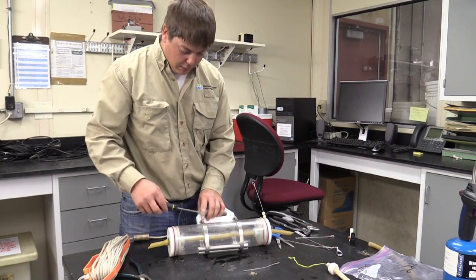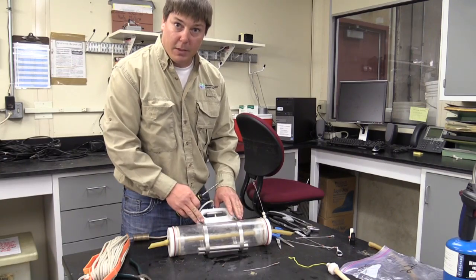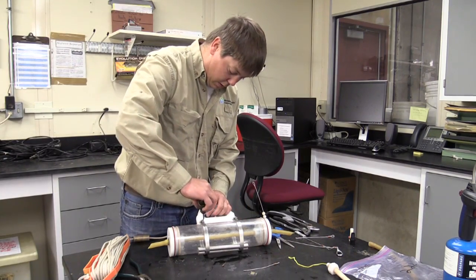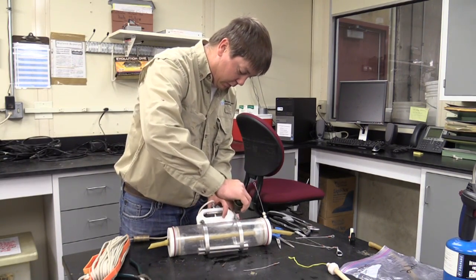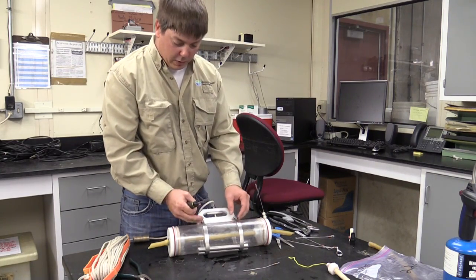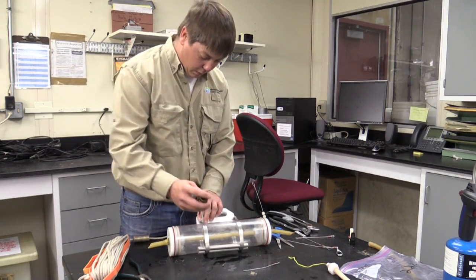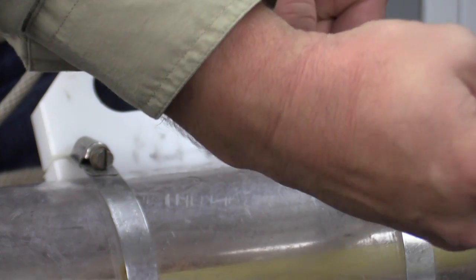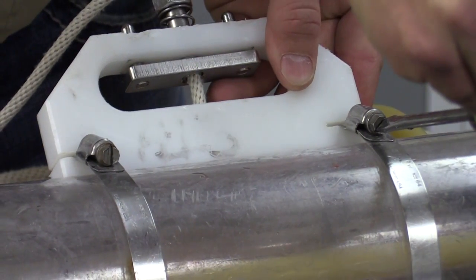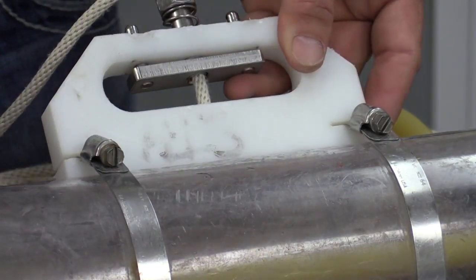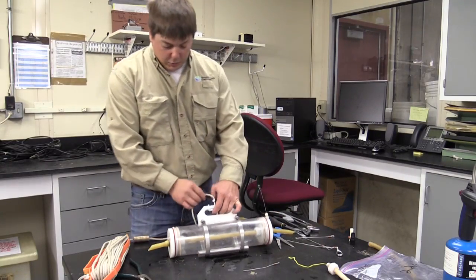Reminders: be sure, and you should be checking this from time to time when you're out sampling, just make sure these hose clamps stay tight. I have had them loosen up out in the field before. So double check those, and you should be good to go.